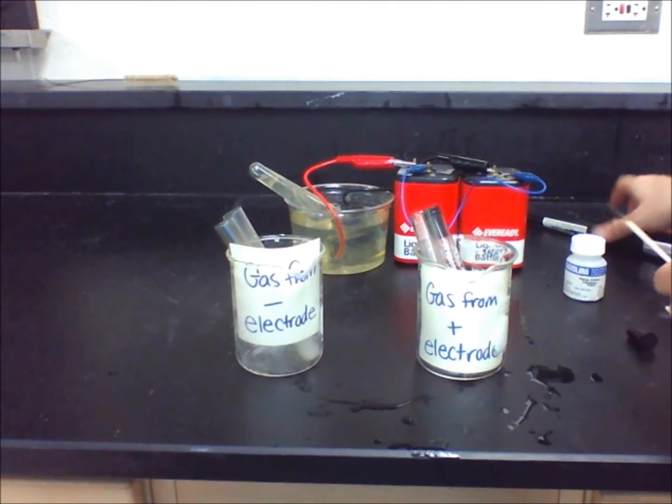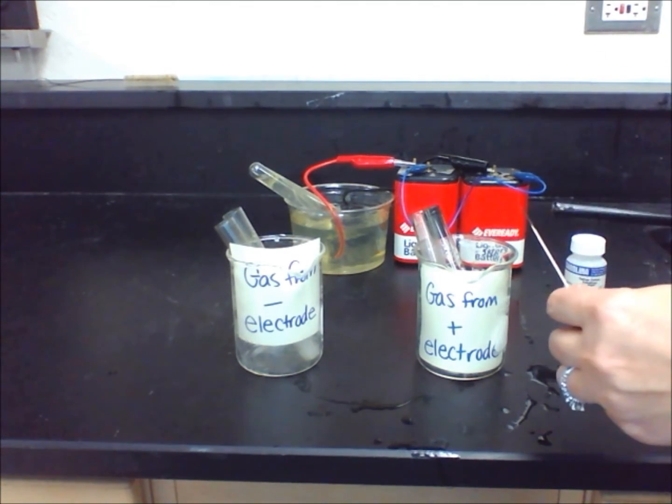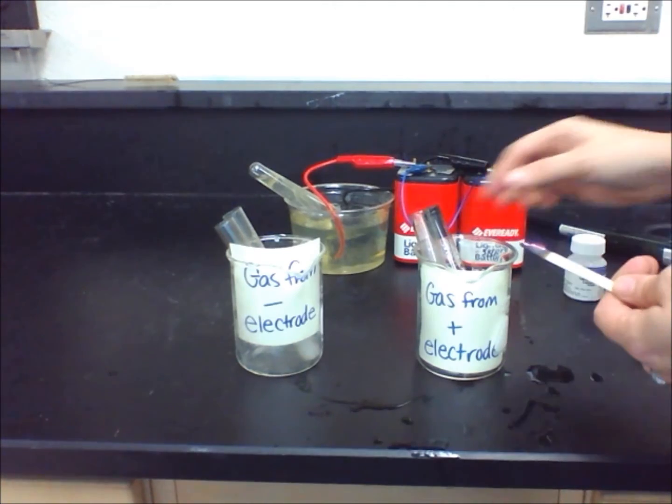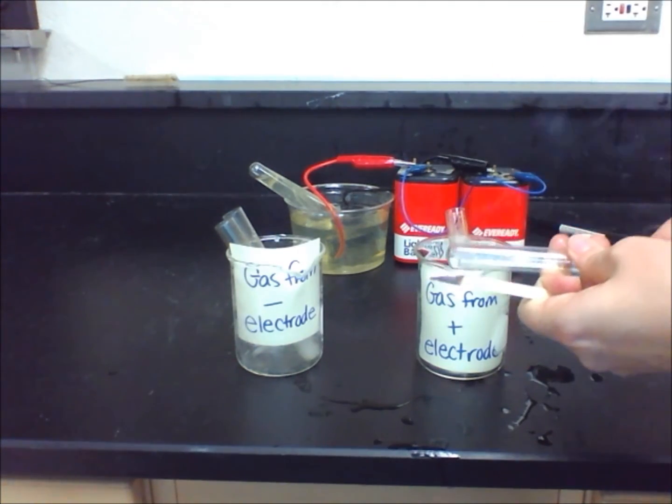When I test the gas collected from the positive electrode in tube 4 with a glowing splint, you will see the splint relight and then go out.